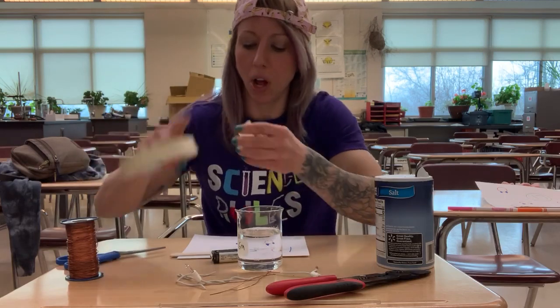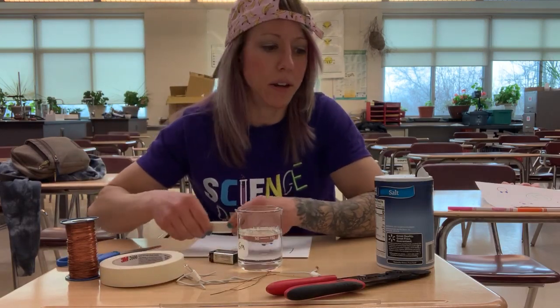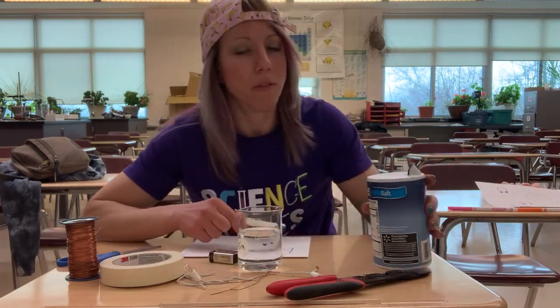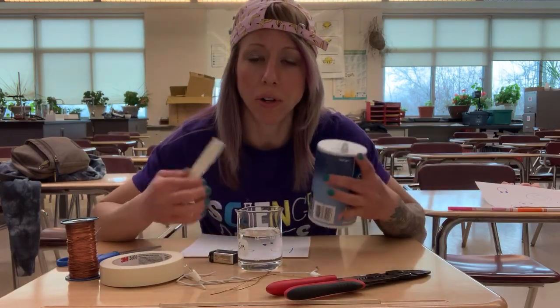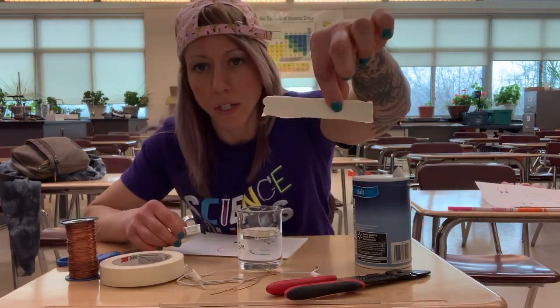And I also have some salt on hand because I'm gonna show you the difference between deionized water and something that's not deionized. So if I add salt, that's gonna add a lot of sodium and chlorine ions that are gonna conduct electricity for us. So I tape my popsicle sticks together.